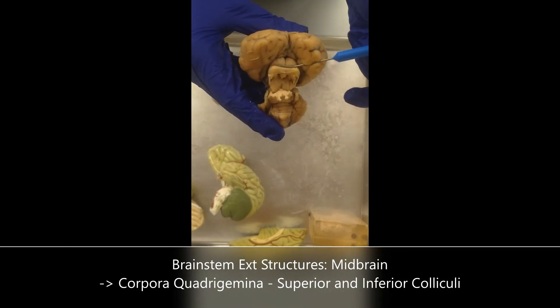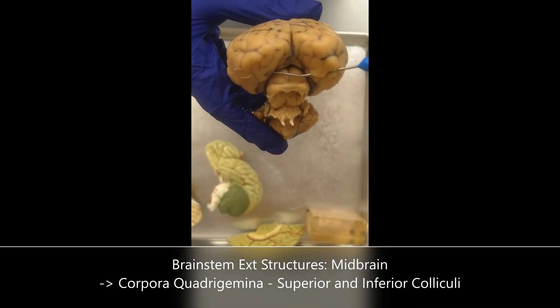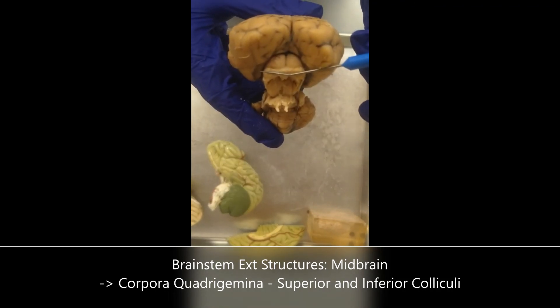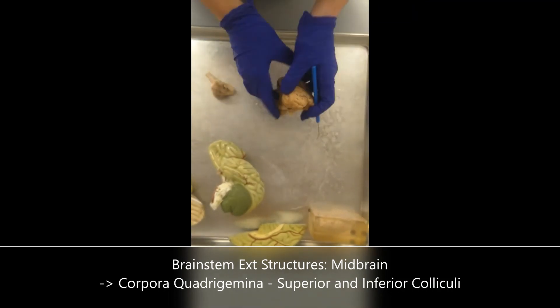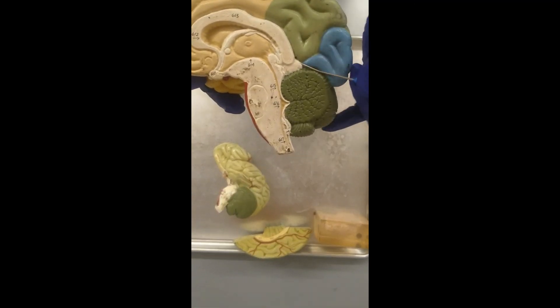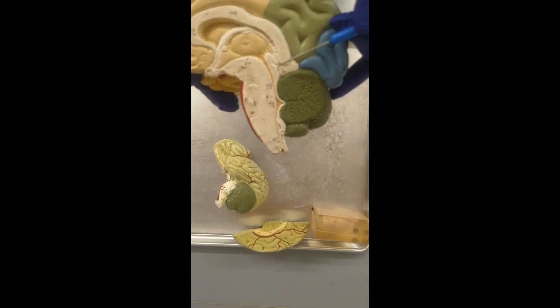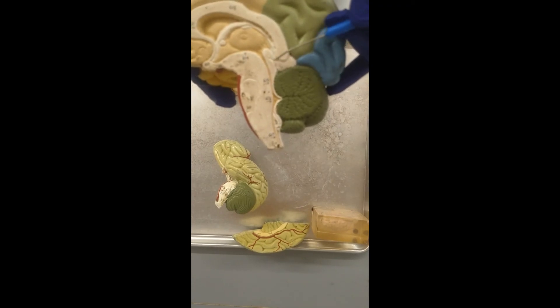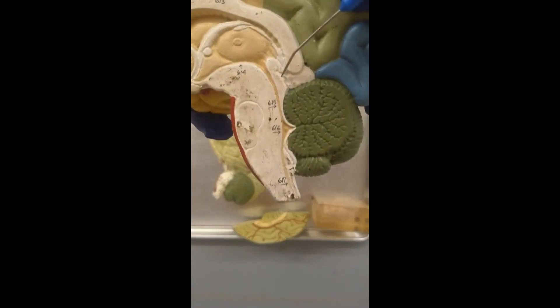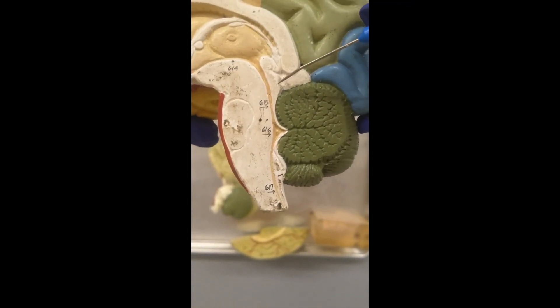Superior colliculi are going to receive signals from the retina — this is involved in a lot of the vision pathway. The inferior colliculi are going to be involved in a lot of auditory pathways. On the sheep brain, we took the cerebellum and reflected it back to see these structures. So on this half, the superior colliculi receive information from the retina for vision, and the inferior colliculi receive information for auditory pathways.